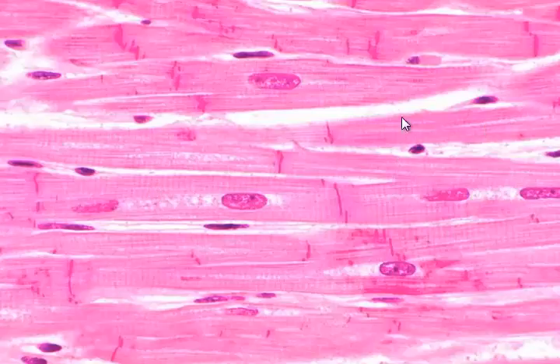You will also see some branching happening here, so the tissue goes mostly left and right, but you see some of these cells branching, and it's not too obvious in this slide, but it is in the other quiz. Some of the branching that takes place. Ignoring the white space, that's just space between the cells.